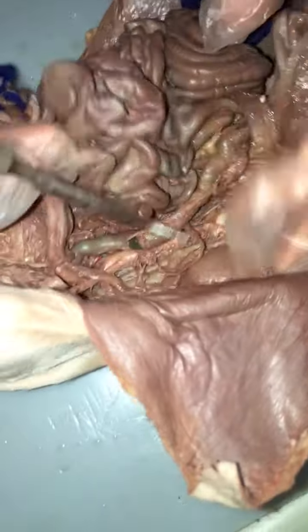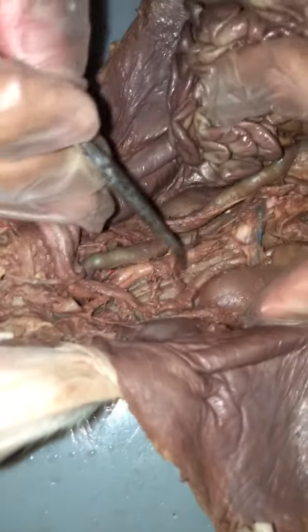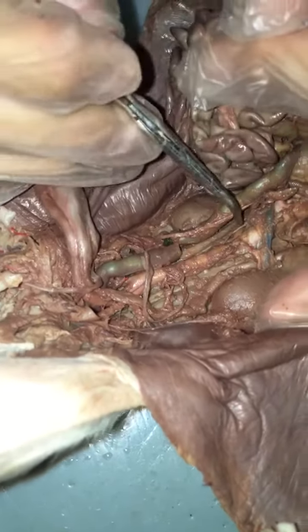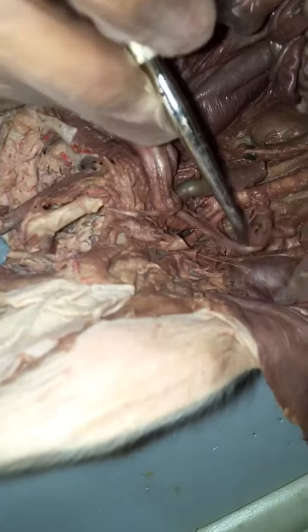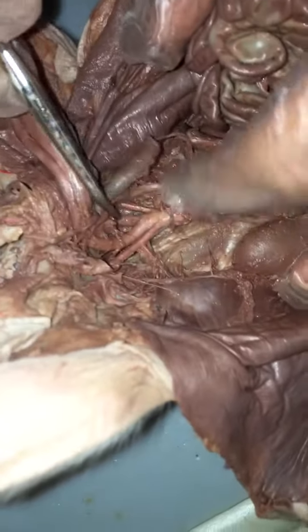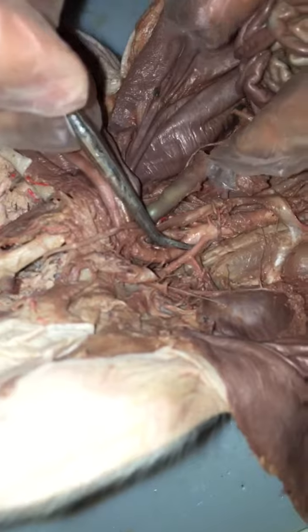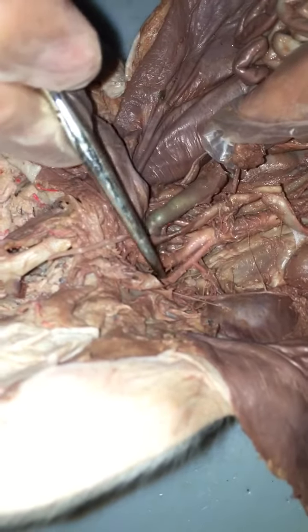Renal arteries go from the dorsal aorta to the kidneys. All of these arteries are coming off the dorsal aorta, starting with celiac, then superior mesenteric, and the renals. And then here you have the iliac, right here. Iliac arteries, coming down, you have external iliac and internal iliac.